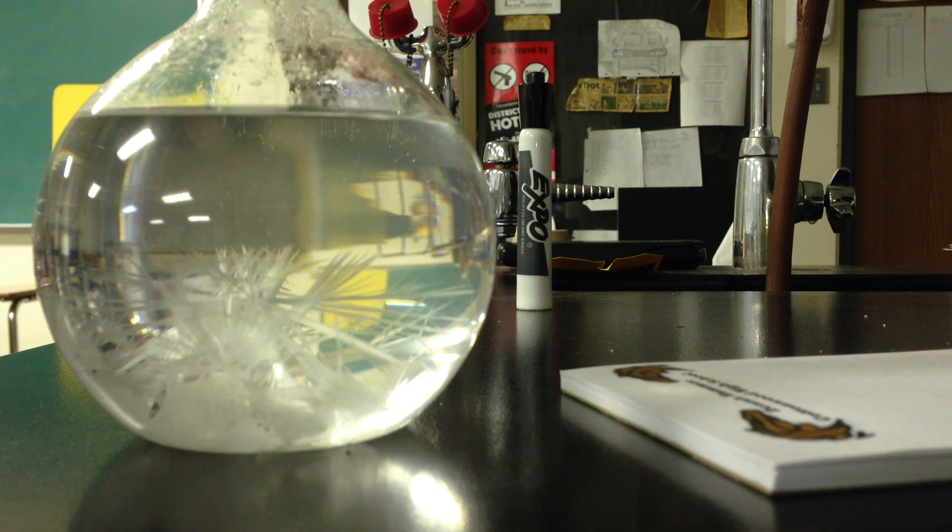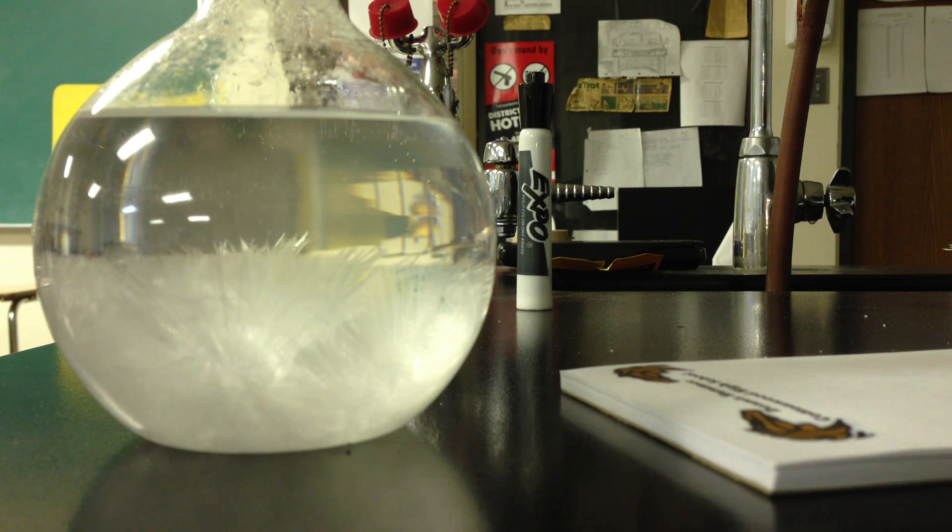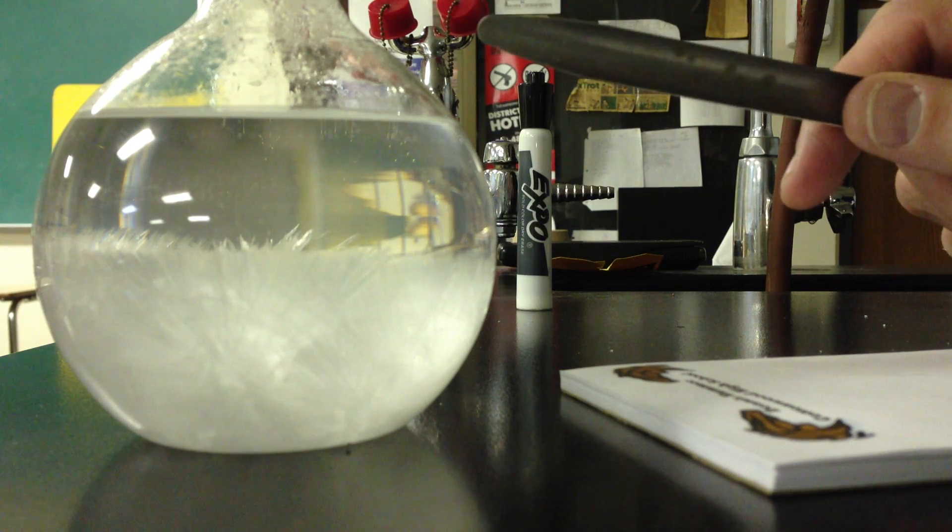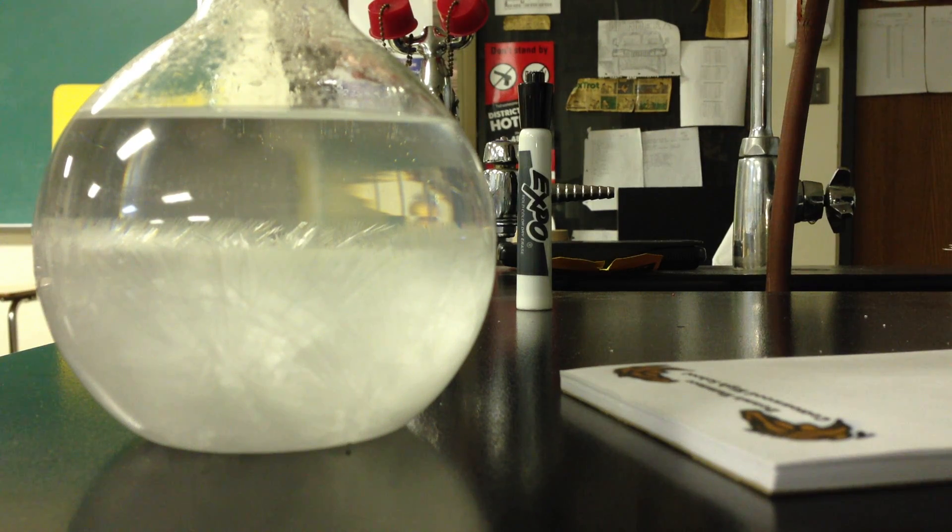Yeah, it gets a little bit spiky and it's going to continue to form that crystal until it returns back to its saturated state. So we have, we're going from supersaturated. And when that's done crystallizing, it'll be back to its saturated state.